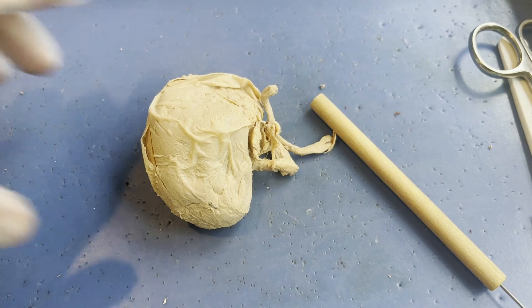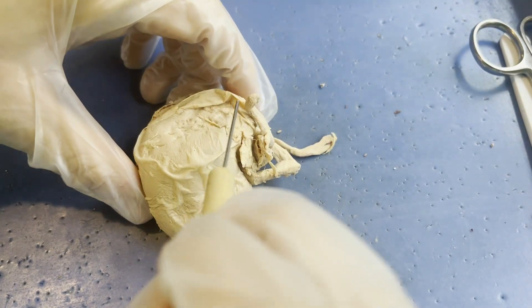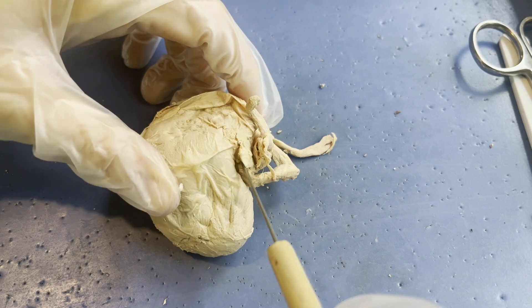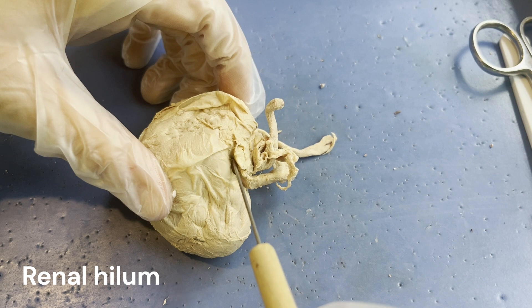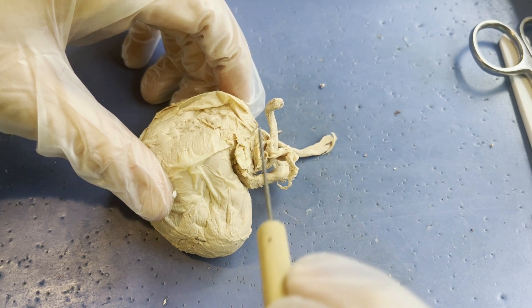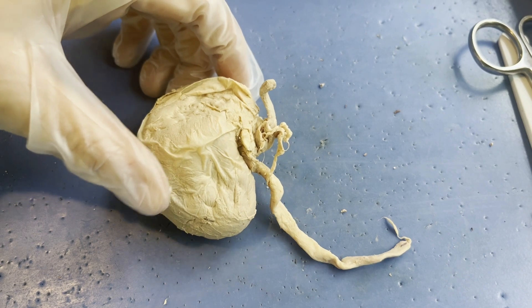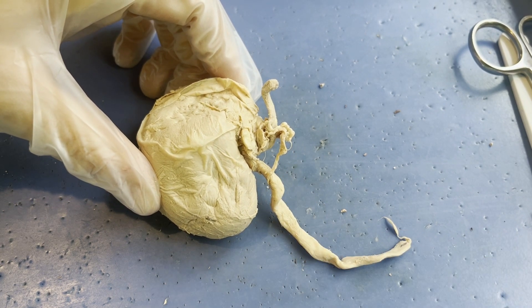You can see where kidney beans got their name because our kidney has a very kidney bean-shaped structure — it's curved on one side and indents on the other. This indentation is known as the renal hilum, or renal hilus. This indentation has three pipes or tubes that come out of it, and if you understand the anatomy and physiology of a kidney, you're probably very familiar with these tubes already.